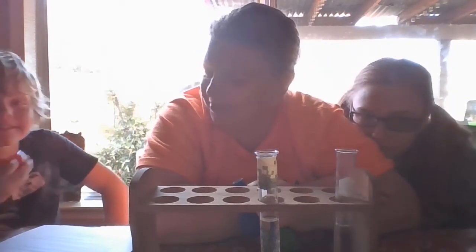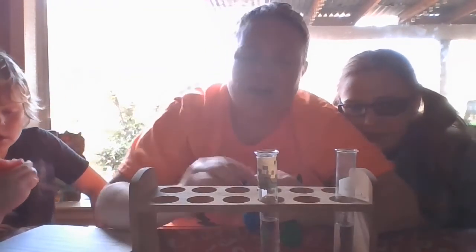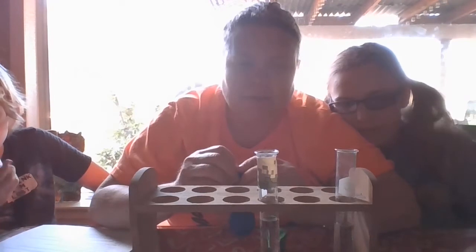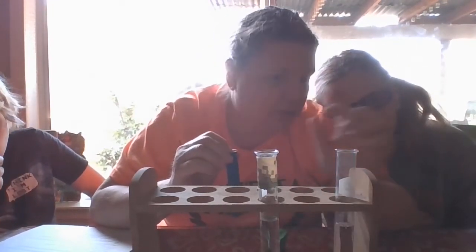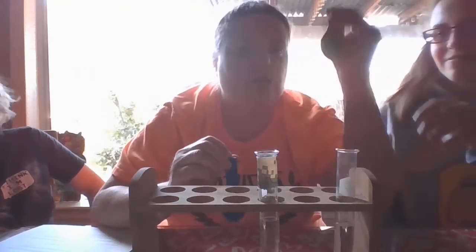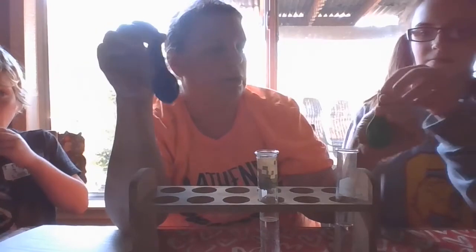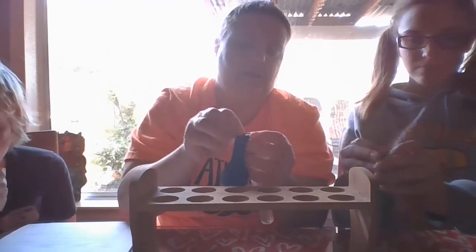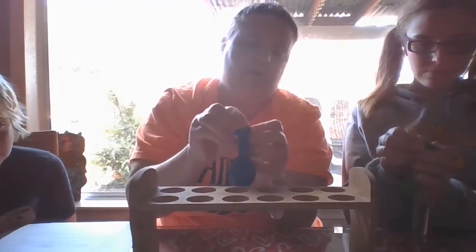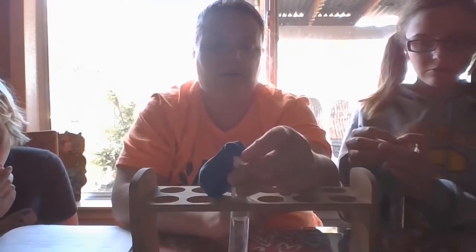Okay, so I'm going to go ahead. You should have answered A, but we're going to go ahead and put our balloons on, and we're going to make our reaction start. Josie, do you want to put it on this one? Yes. Okay, so the green one is going to be the higher concentration, and the blue is going to be the lower. So please don't break the test tubes. Okay, don't dump it yet. Just remember, put it over the mouth of the test tube, but don't dump the stuff in yet. Okay, so just like that.